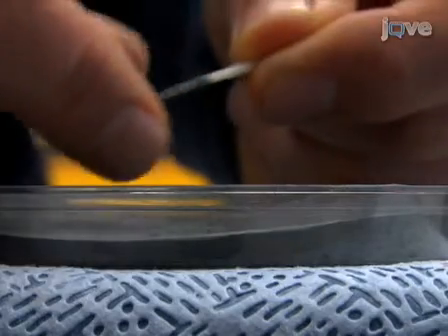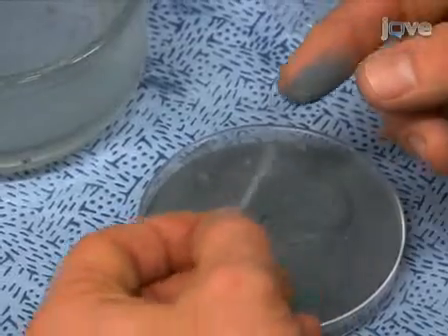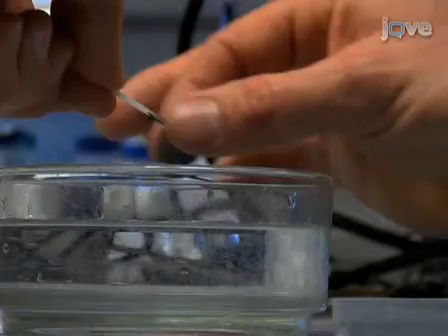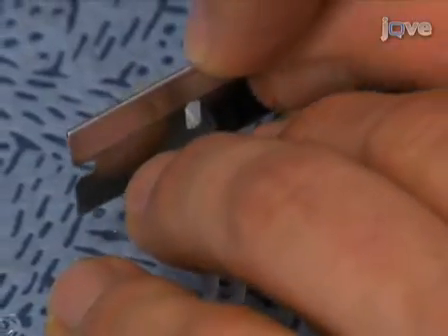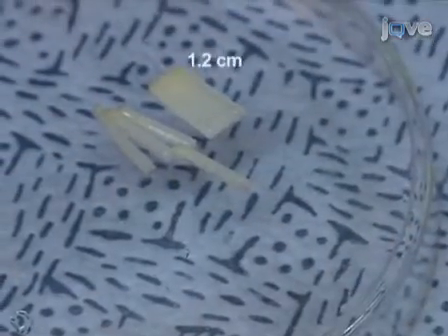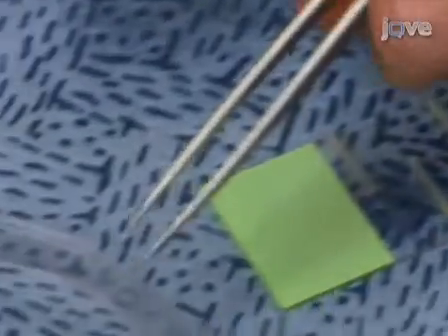One should also work quickly because as the frozen hypocotyl thaws, it becomes flaccid and hard to manage. To remove most of the adhering carborundum, the abraded hypocotyl is dipped and then stored in ice water while the remaining hypocotyls are being prepared. Following cuticle removal on all seedlings, they are cut to the desired length, usually 1.2 centimeters, with a new single-edge razor blade and then aligned on a glass slide.